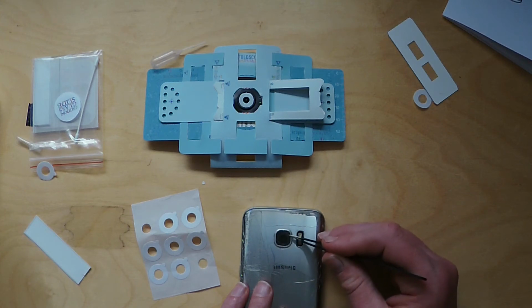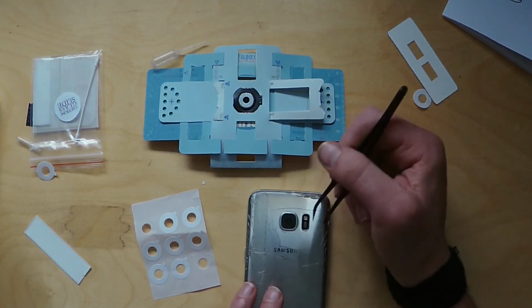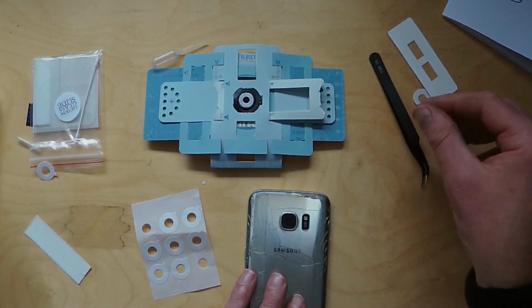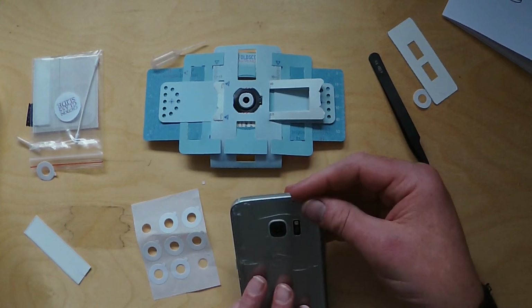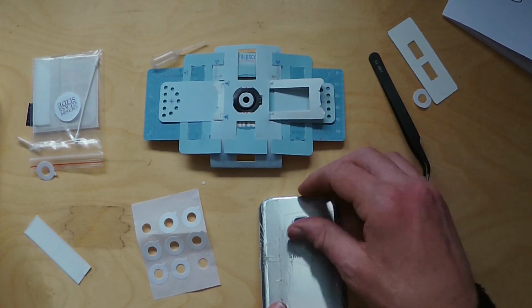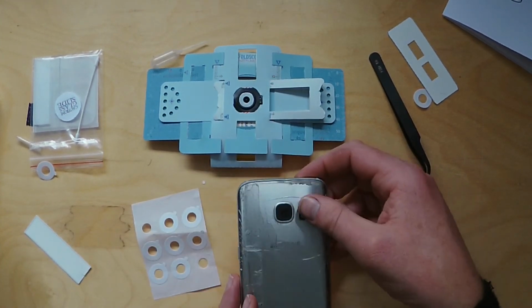You can use the tweezers to adhere it quite strongly to the lens. Oh yeah, so this doesn't damage the lens in any way. Obviously your tweezers might, so take care doing that. Maybe fingers are better. But you can peel this off again and quite easily just wipe away any residue of the sticker, either with a bit of spit or alcohol or water. It'll come off easily. I've done this numerous times. These cracks are nothing to do with the Foldscope, it's to do with me dropping my phone. Okay, so you've got that sticker on there.